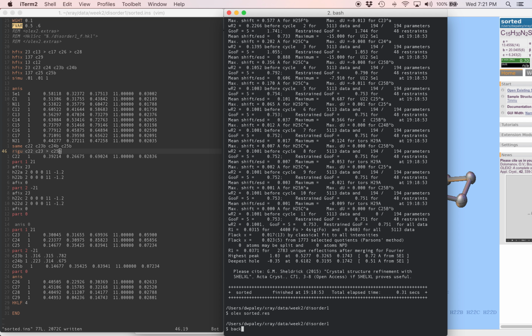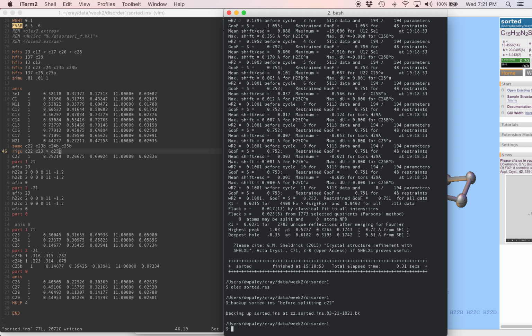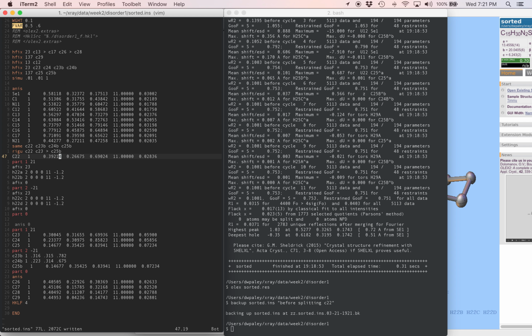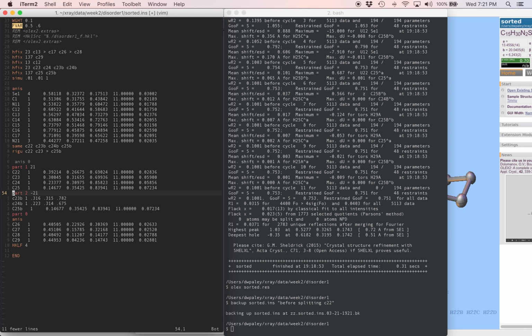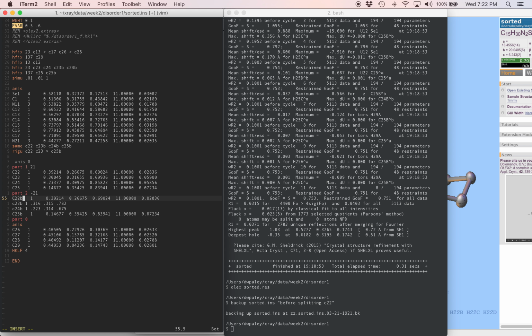We'll back up the model that we've got right now. Back up sorted.ins. We'll call this before splitting C22. Now if we need to come back, we'll have this and we won't have to do it all again. So I'm going to take C22. First, these hydrogen atoms. If we're splitting the whole atom in half, then we don't need to worry about this whole fancy thing with the hydrogens anymore. So unfortunately, I'm going to delete this whole part. Carbon-22, I'm going to put it inside part 1, and I'll put a second copy inside part 2. Same as before, we can hope that this naturally splits itself in two positions without us having to intervene.